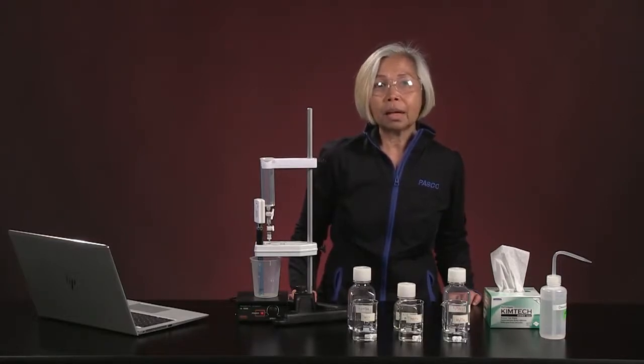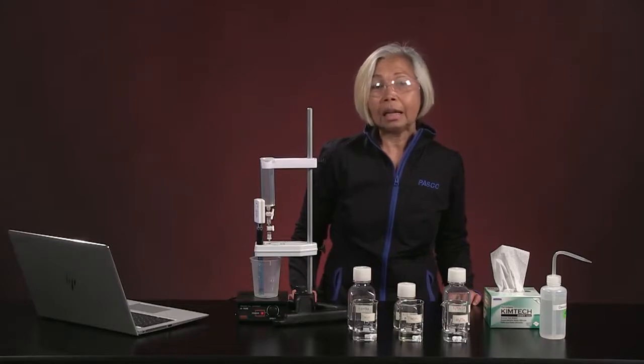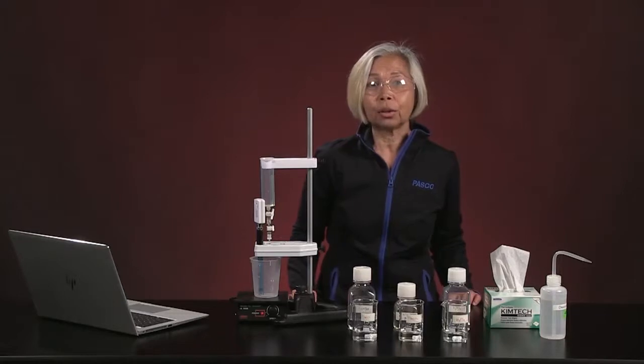In this lab, we will be examining the titration curves of a strong acid, a weak acid, as well as a polyprotic acid. In the end, we will relate the information that we get from these titration curves to their Ka values.